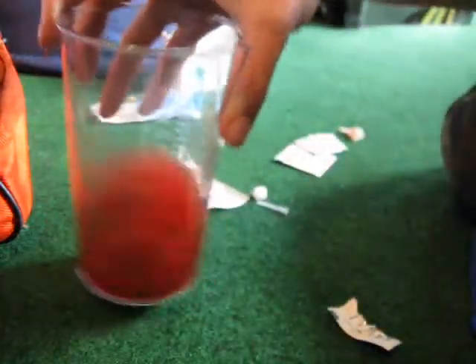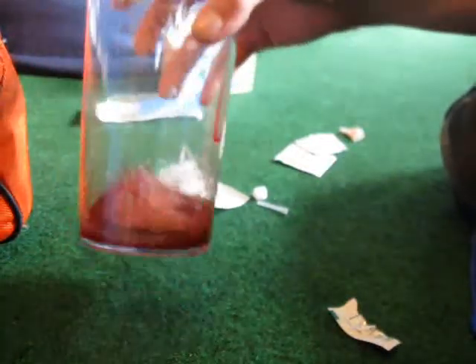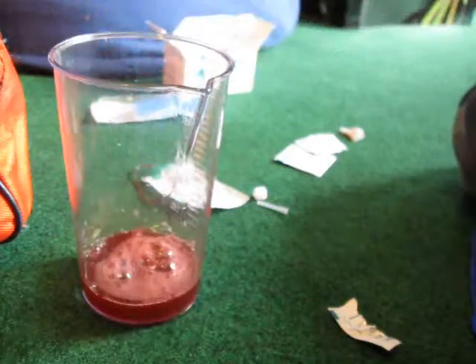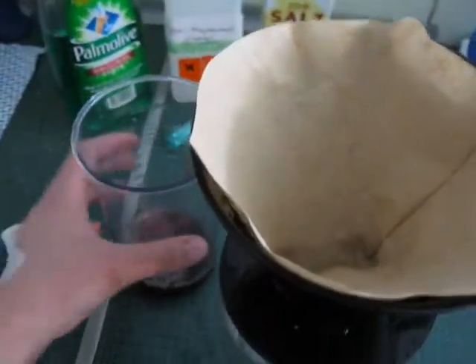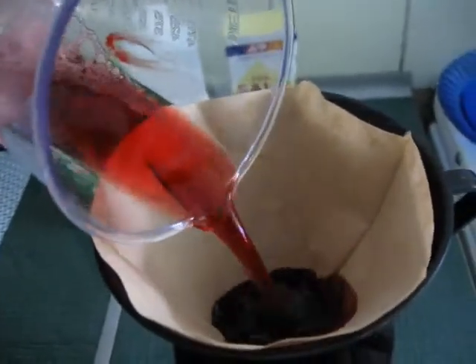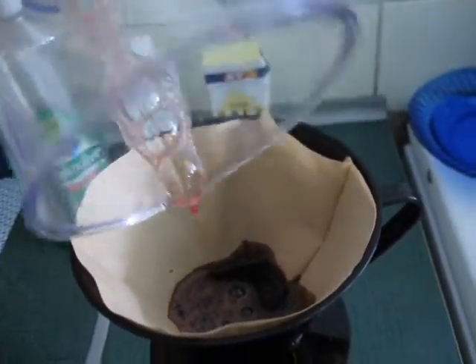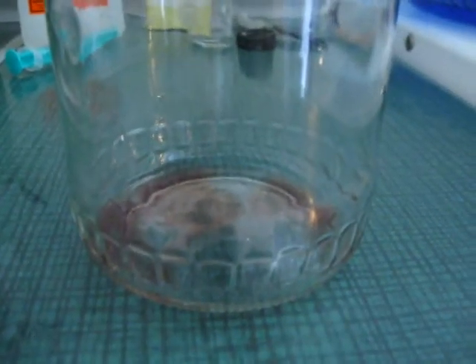Let's stop this and then stir the solution. Nice bloody solution. And back in the kitchen, we're going to filter my bloody solution. This may take a while because the process is rather slow — you can see the drops setting up.